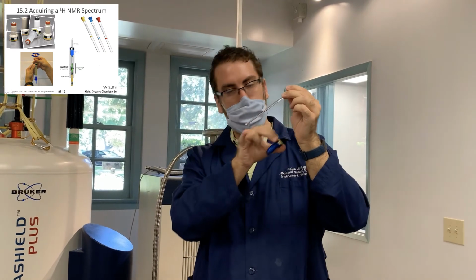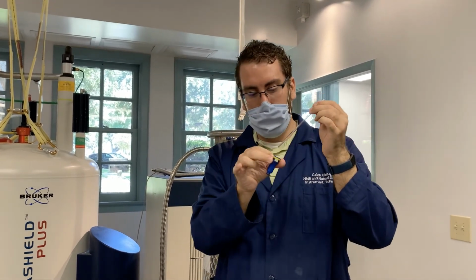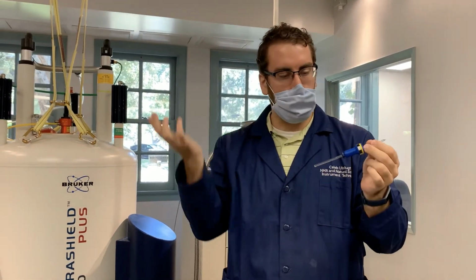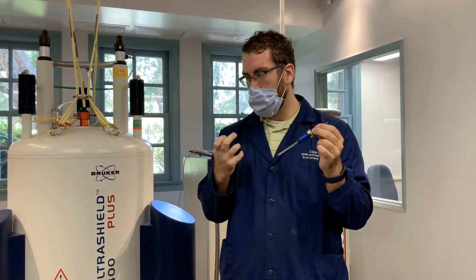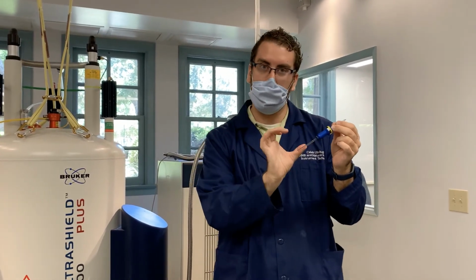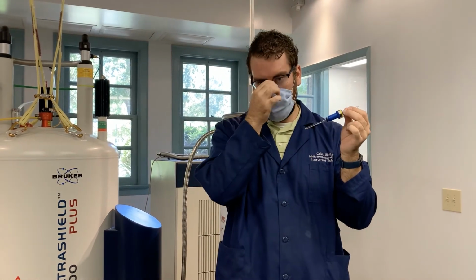So most of this is solvent, and there's just a little bit of your liquid dissolved in it. In terms of how much sample you need, you only need a few milligrams to get a good NMR signal. So yeah, it's a very sensitive technique in that sense. But as I said, we use the magnet and it looks at all of the hydrogens within your solvent or within your sample. So then how do we differentiate between the solvent and our sample?